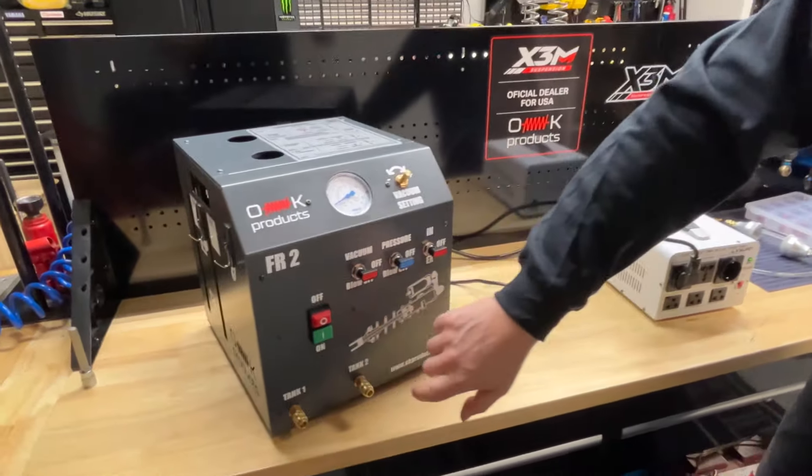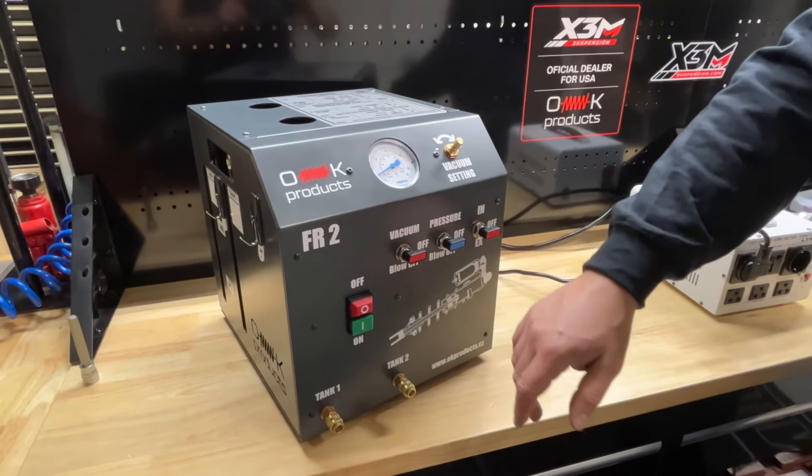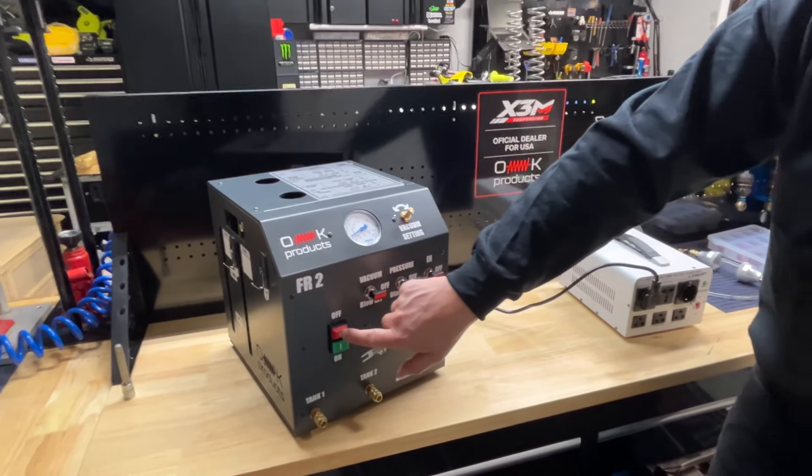You can do it again — it's working beautifully, working smooth. So we can turn this off.